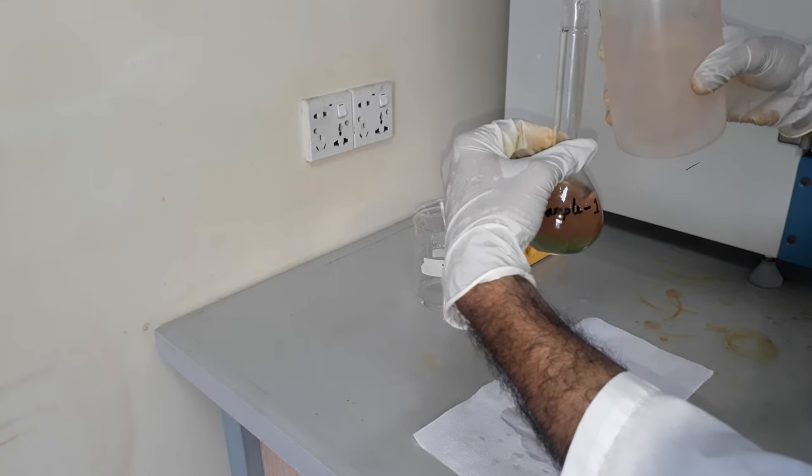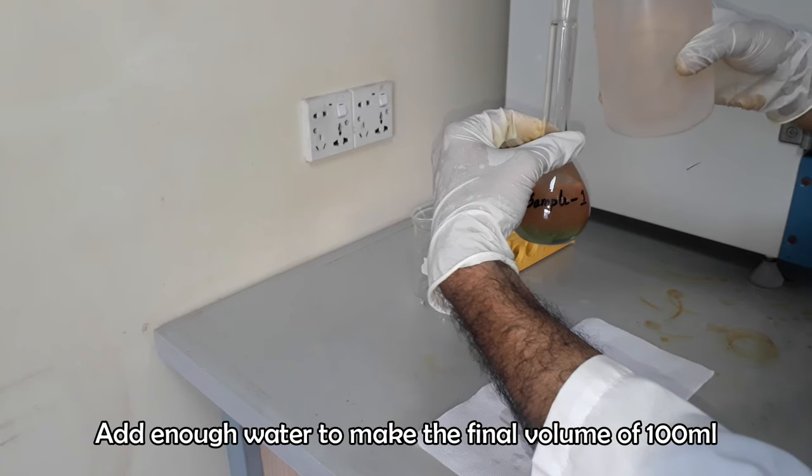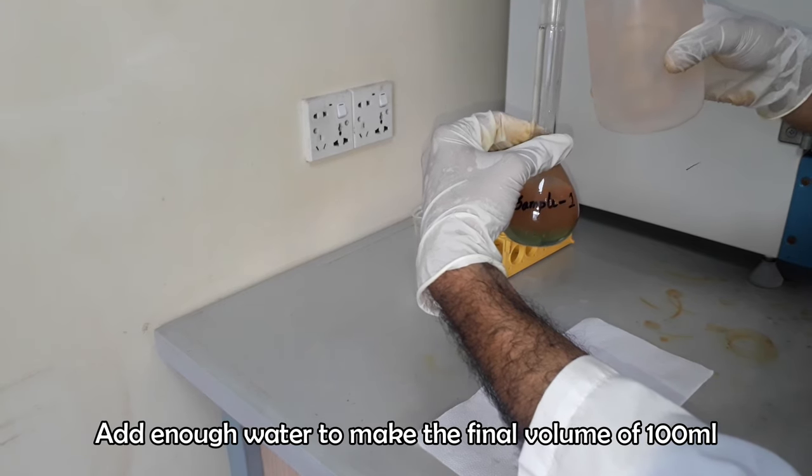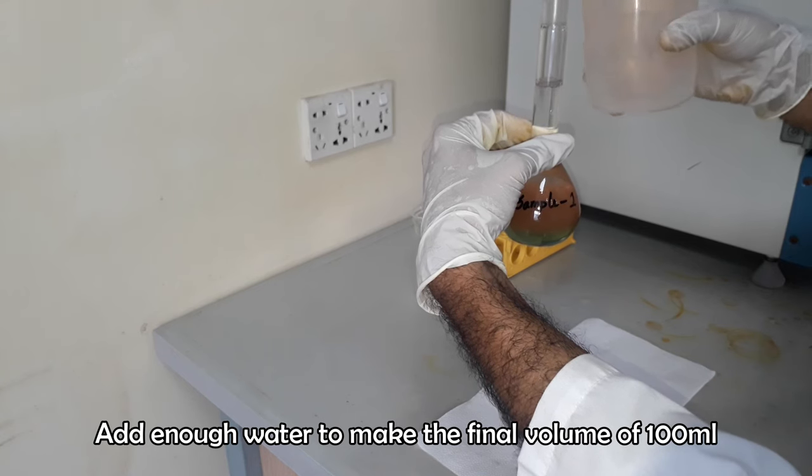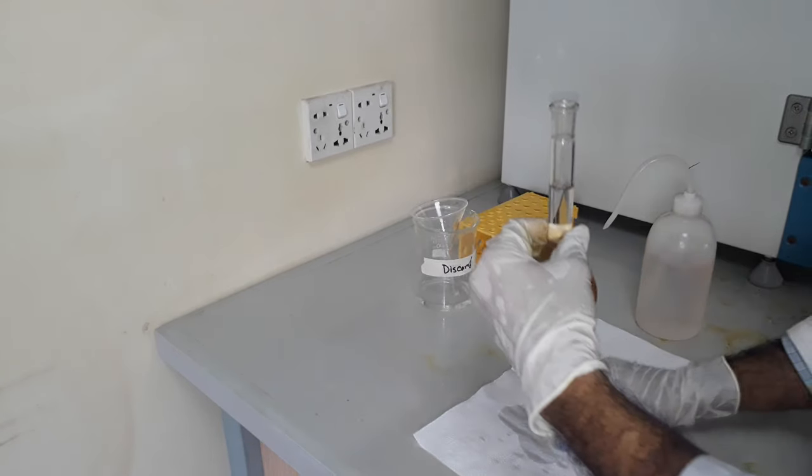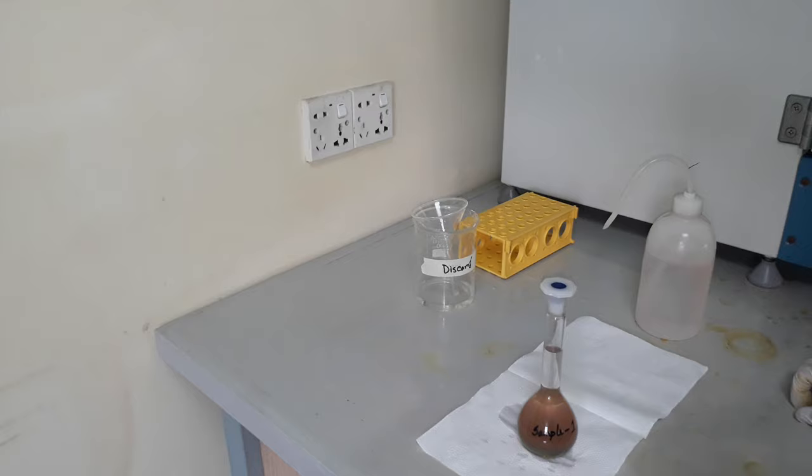Add water to the volumetric flask to make the final volume of 100 ml. Now we are ready to go for the distillation.